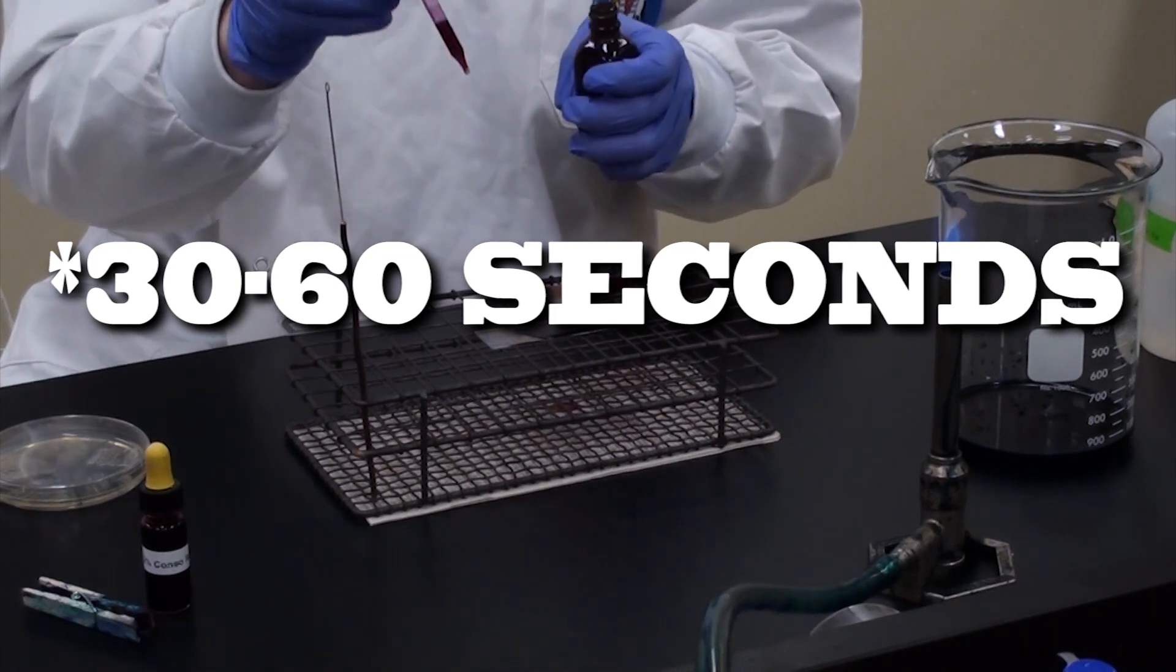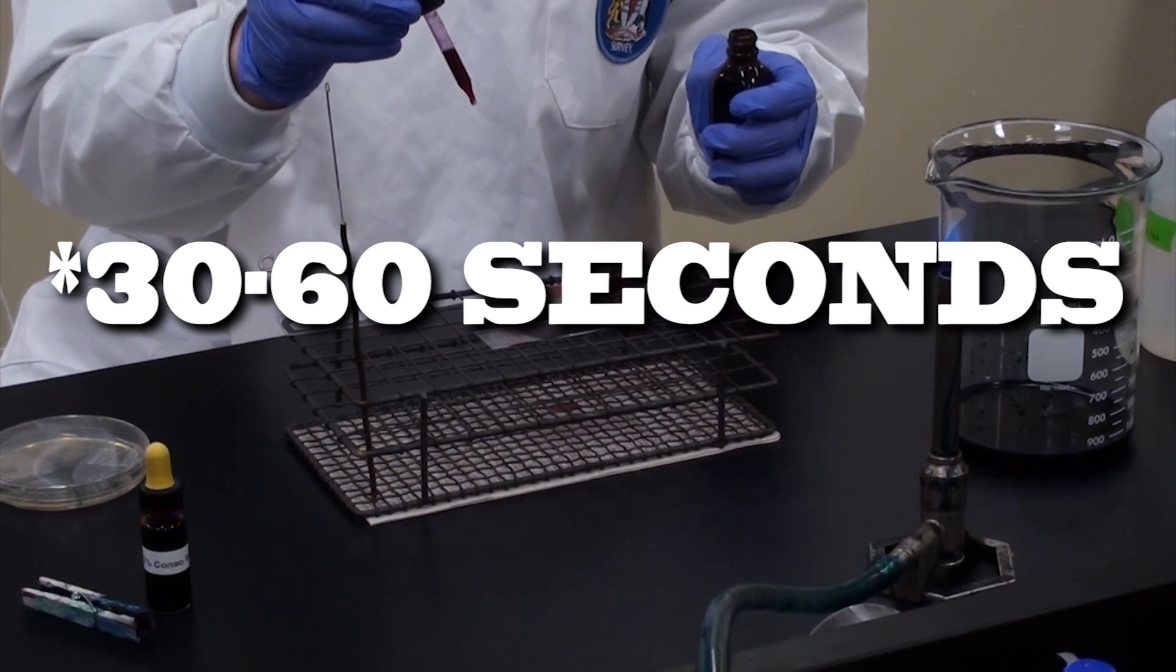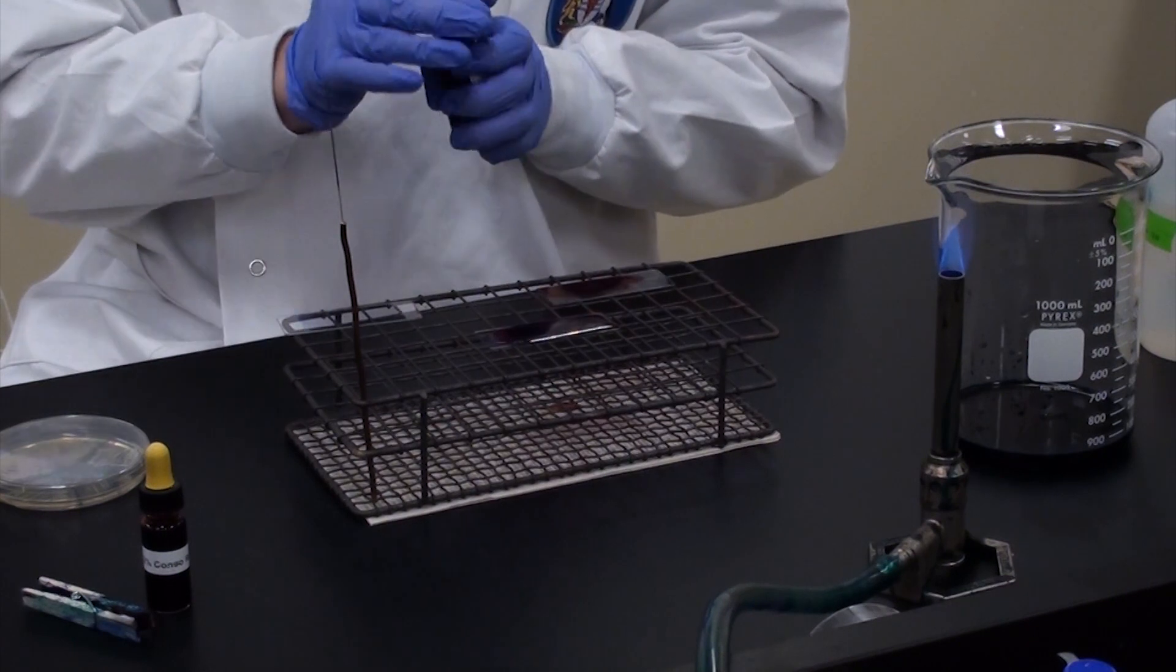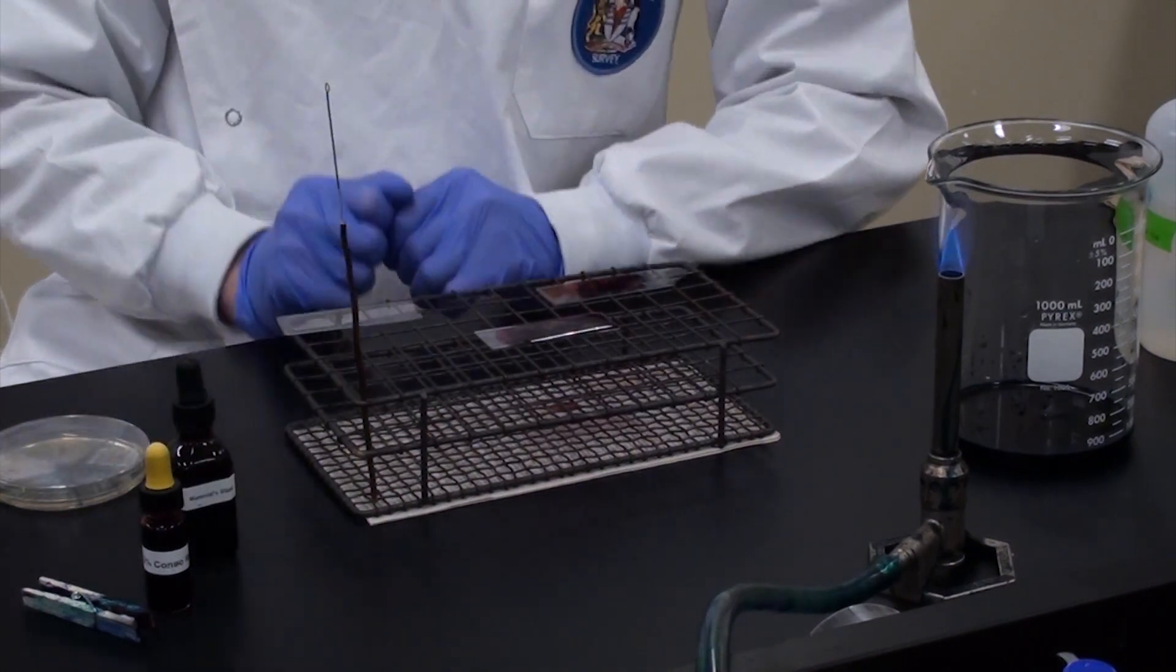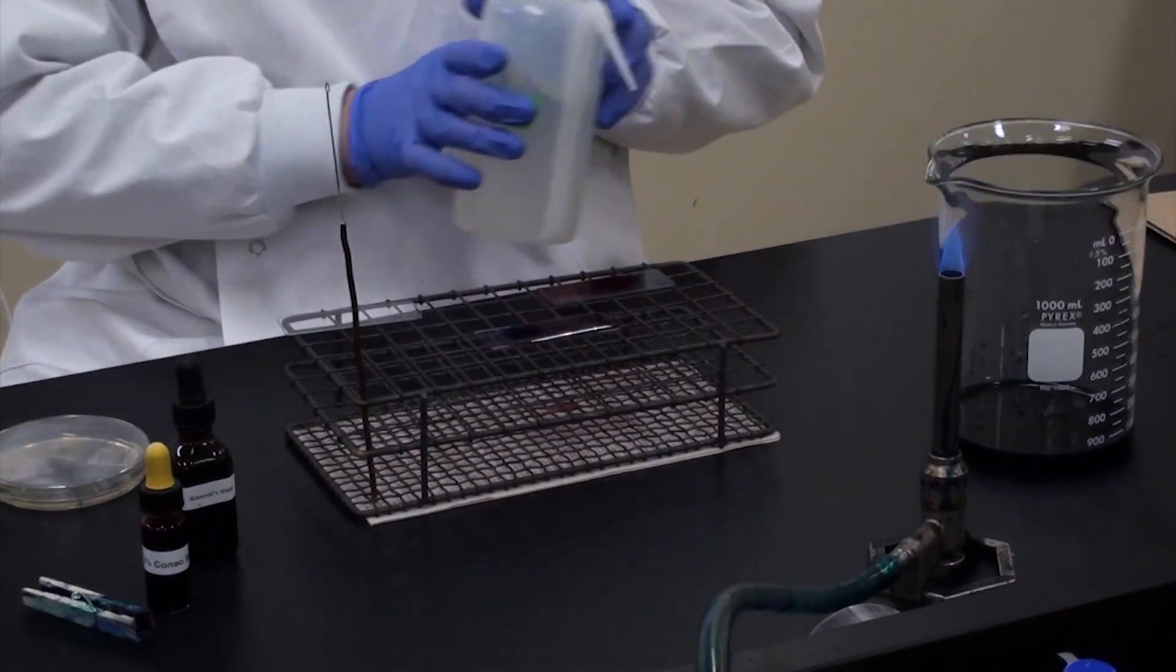Actually just 30 seconds. You will wait before washing that off. Awesome. Here we wait. Done. 30 seconds goes by so fast when you're having fun.